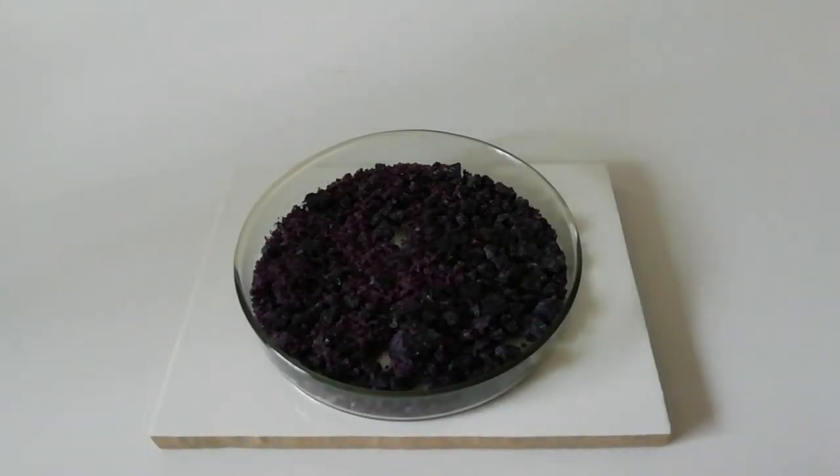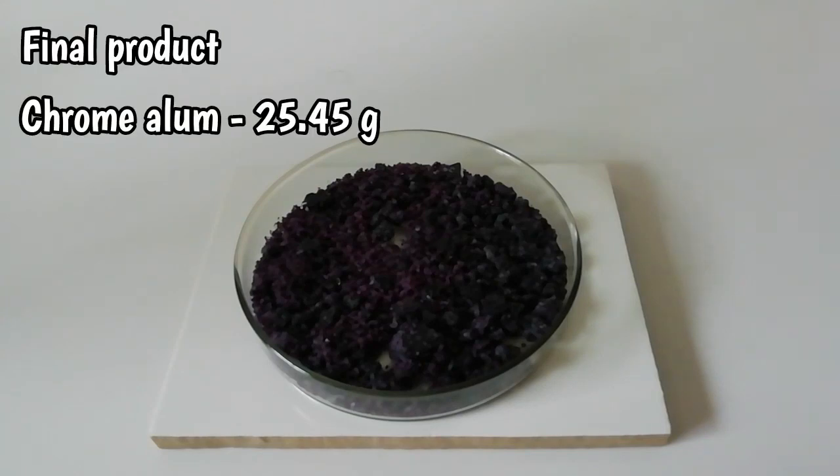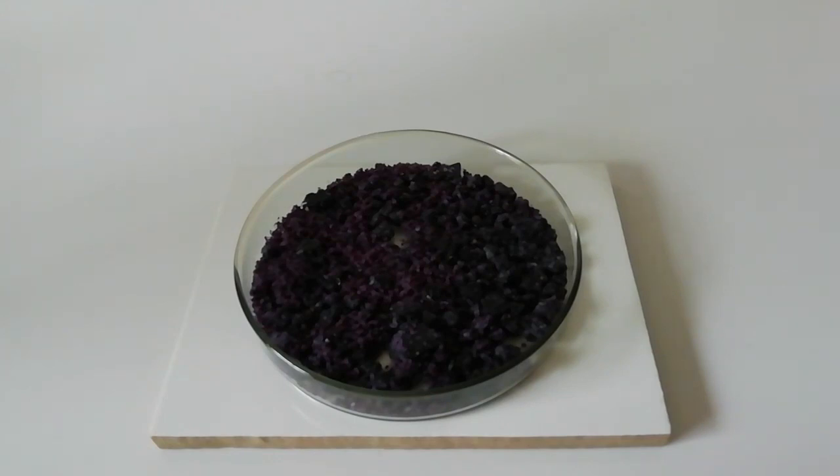After filtering the product, you can see here our final product: chrome alum. These are nice purple crystals. We can grow larger crystals from these chrome alum crystals. I will do a separate video about chrome alum crystal growing.